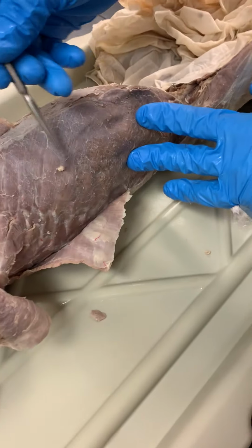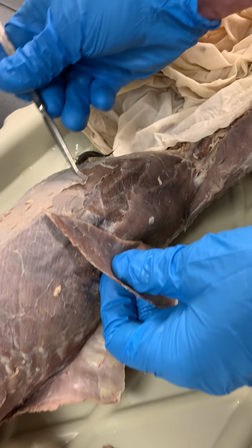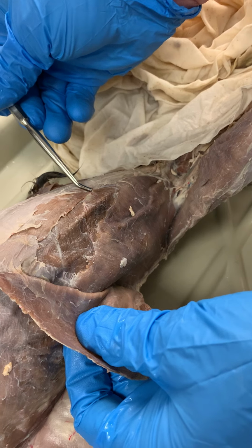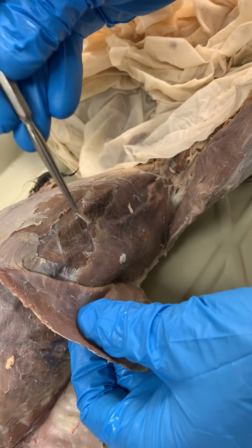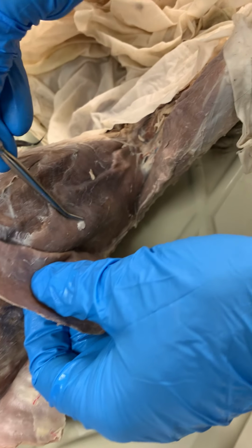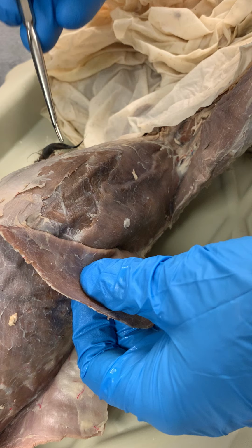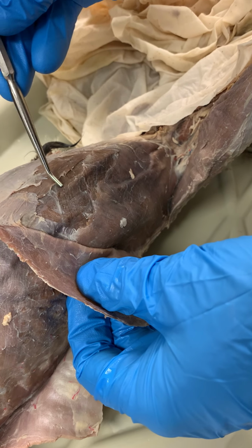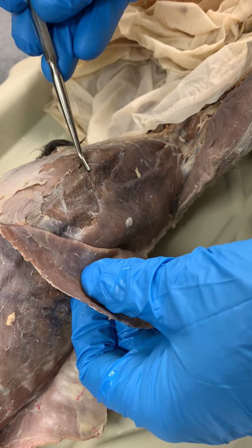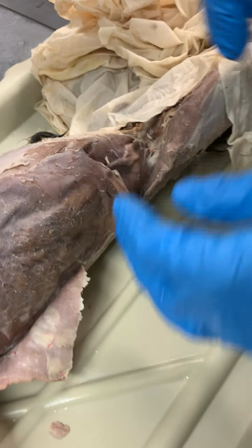All right, looking at the abdominal wall, obviously, again, we can see our external abdominal oblique very nicely here. We reflect that back. Here's our rectus abdominis, our internal abdominal oblique. Note the fiber pattern is oblique on both, but perpendicular to one another. And then the deepest muscle of the group will be our transversus abdominis, which in humans has a transverse fiber pattern, but as you can see in your kitty cat, it's actually going to be another oblique fiber pattern. Moving on to the back.